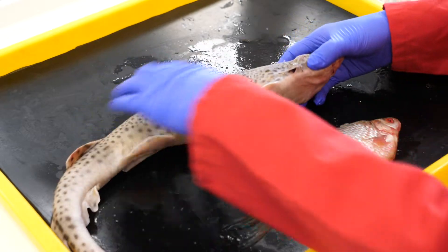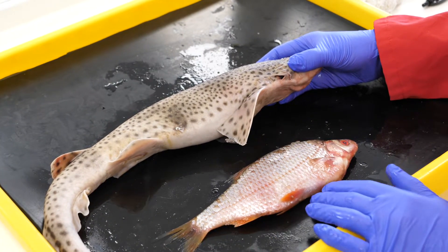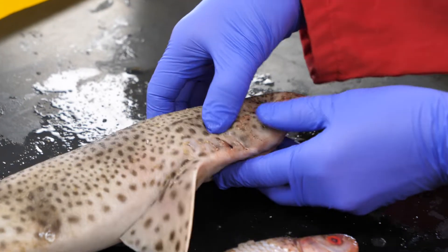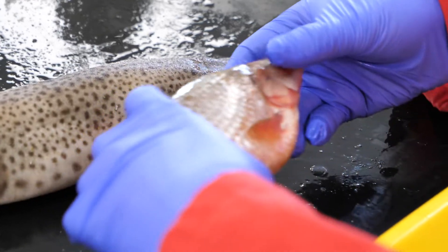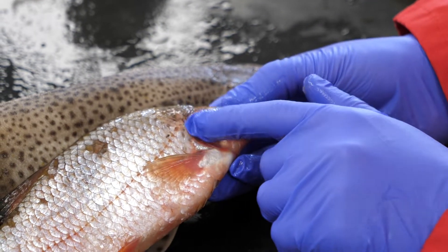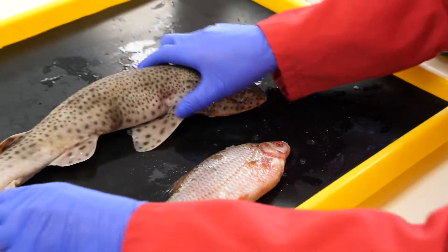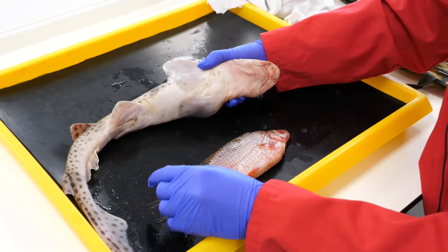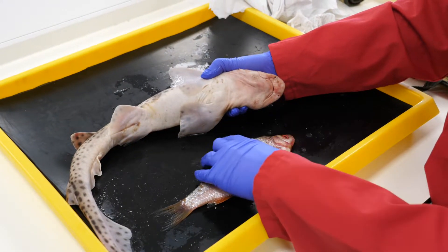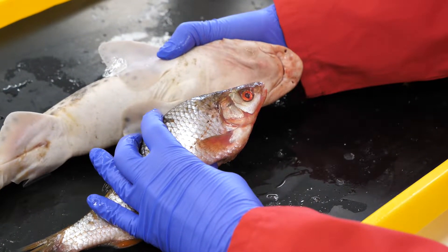The gills are exposed, so if we compare that to the bony fish, you can see the gills on the side of the shark here. But on the bony fish, they're covered — they're on the inside of this bony flap of skin called the operculum. Remember these are both jawed fish, so on the shark the mouth is on the underside of the head, but on the bony fish the mouth is terminal, so it's right at the end.